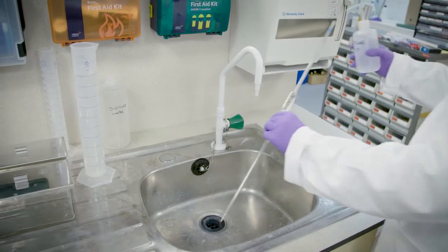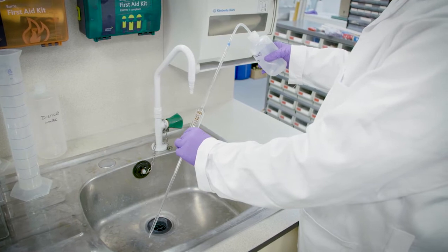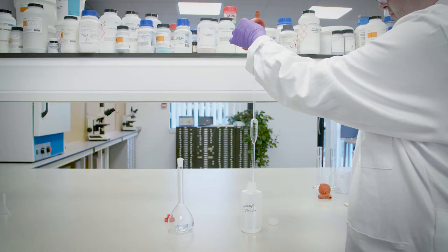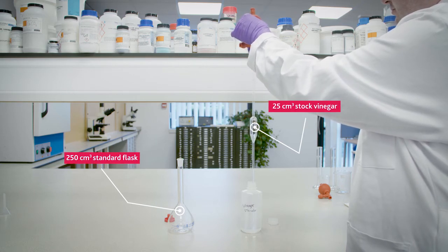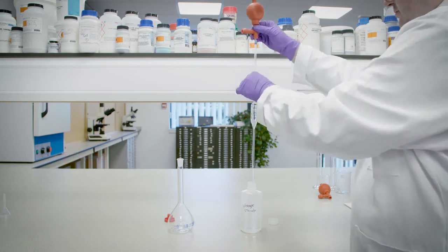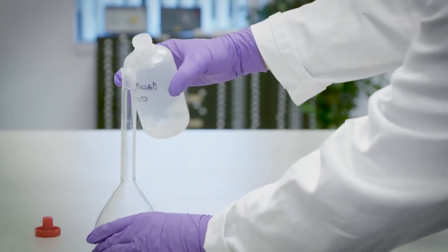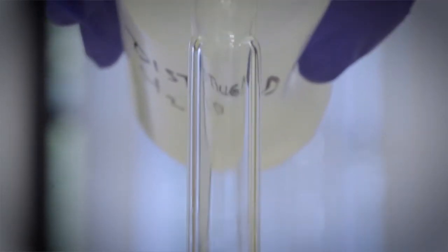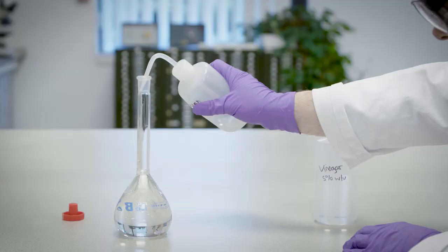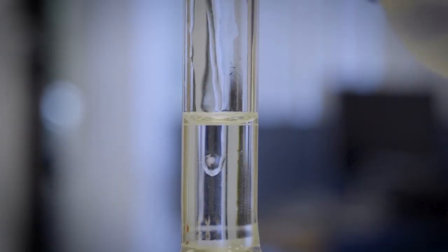First, a dilute vinegar sample needs to be prepared. A 25 centimetres cubed pipette is cleaned by rinsing with deionized water from the wash bottle. The vinegar is diluted by pipetting the stock vinegar solution into a standard flask. Deionized water is then added, and a plastic dropper is used to add the water as the solution gets near to the mark.